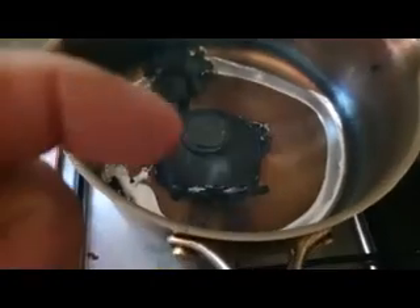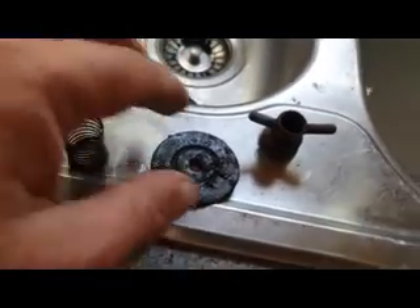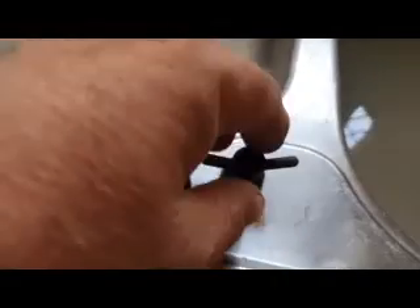Okay, so as you can see it's pouring nicely - molten metal. It's just a matter of letting it all melt. This top half has to melt yet. I can separate the brass now and take that out, let the rest melt. There should be a disc in there, there should be a spring in there, and a few other bits of metal. There's the spring and the metal disc, and the brass piece on the end.